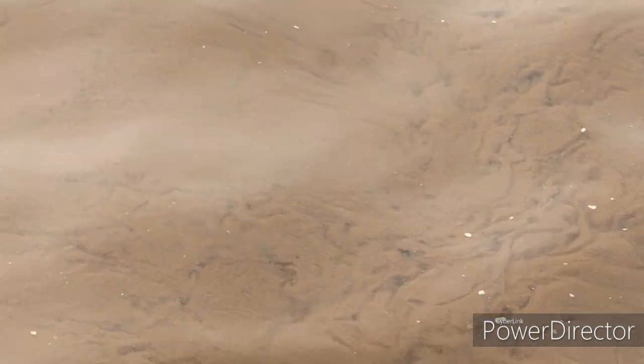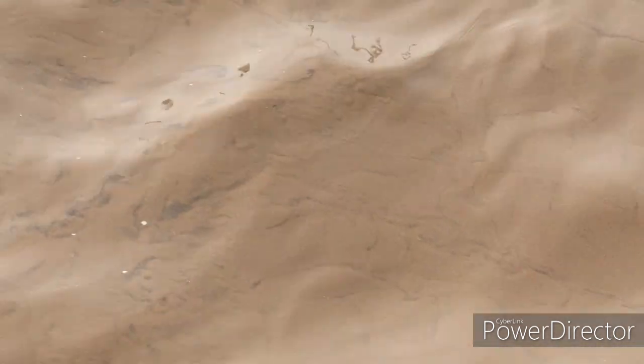Mixed liquor is a concentration of suspended solids in the aeration tank. This mixture of raw and treated sludge is monitored daily to ensure proper concentration is available for the biological treatment.